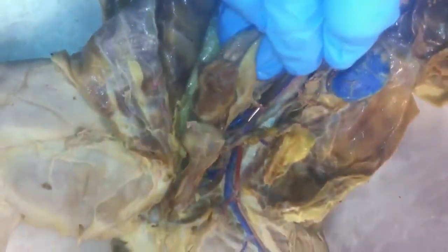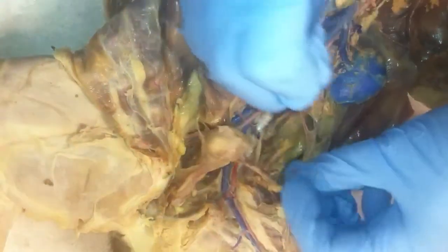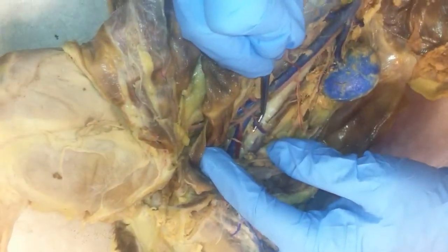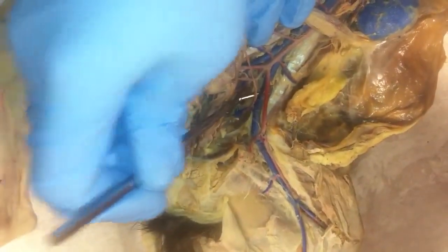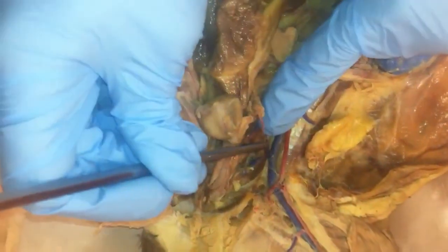This right here, going to the large intestine from the aorta, is the inferior mesenteric artery. Right here, on both sides, are the iliolumbar vein and artery. Here at the end of the aorta, we have the external iliac artery, internal iliac artery. There's no common iliac artery in the cat, but there is in the human. For the veins, it starts out as the common iliac vein, and then the internal iliac separates from it, and the rest is the external iliac vein.